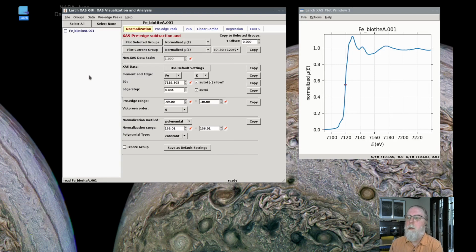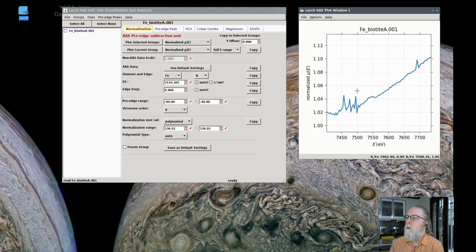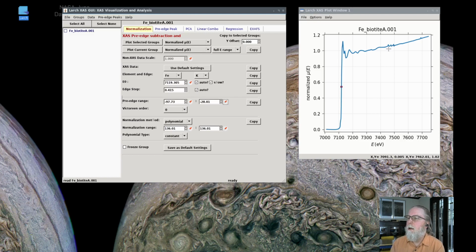So I'll read those in and show the full energy range. And you can see that there's some glitches out here in this range. The glitches aren't too bad, but we should get rid of those. I should also say we should also do the normalization a little better between here and here. That looks better. But let's get rid of these. Let's try to get rid of these glitches in the spectrum.